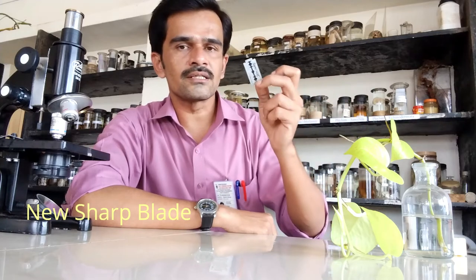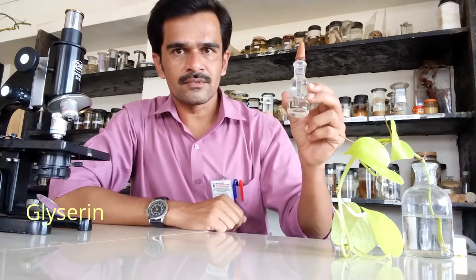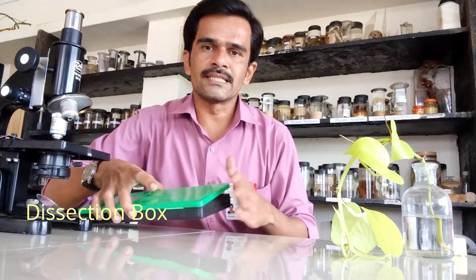The requirements for making a slide are: a glass slide, a cover slip, a watch glass, a new fine blade, glycerin, blotting paper, water, and a dissection box. The dissection box contains many tools for making a slide or dissecting any biological object. Most importantly, you will also need a compound microscope.